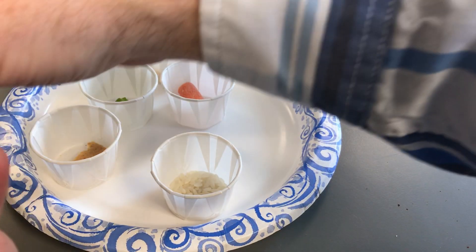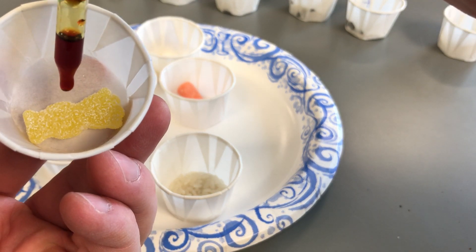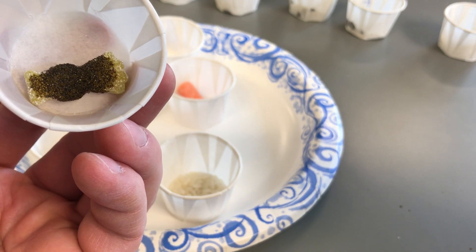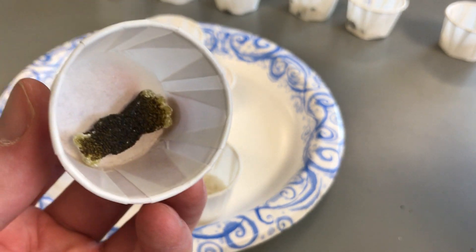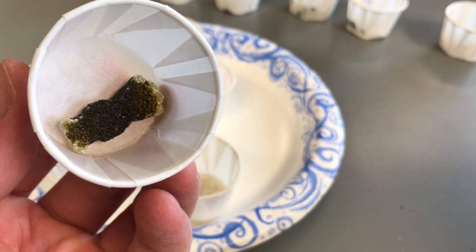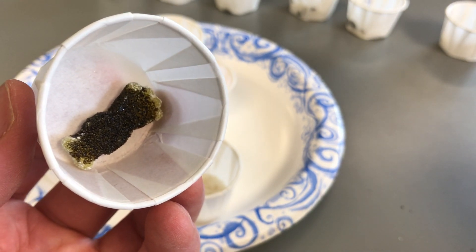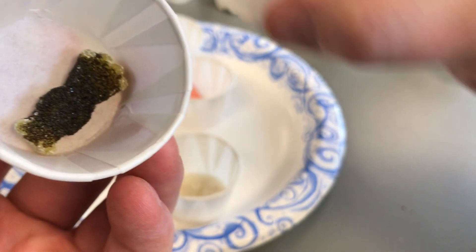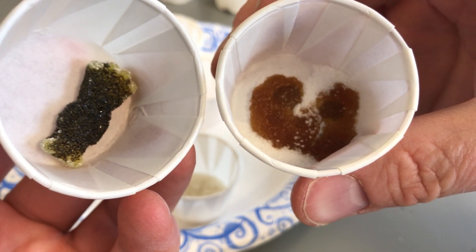The sour patch kid is really interesting. We drip it on and notice it spreads all the way through the material. Notice how fast it changed — it was instantly a different color. You'd think candy is sweet and full of sugar, and yes there's a lot of sugar on the outside, but the gummy material on the inside is very heavy in starch — lots of complex carbs — versus the sugars on the outside. As soon as it spread in, it changed to that dark color. Comparing it to glucose, sugar still has that reddish amber while the sour patch kid turned nice and dark.